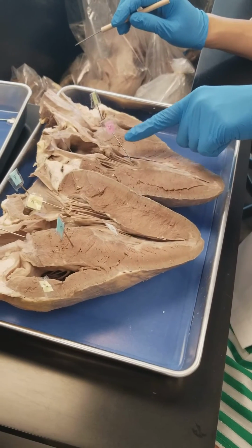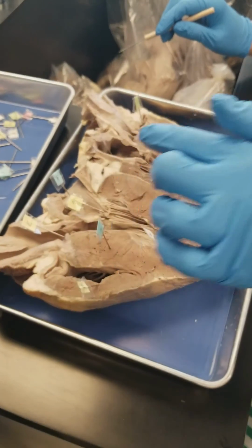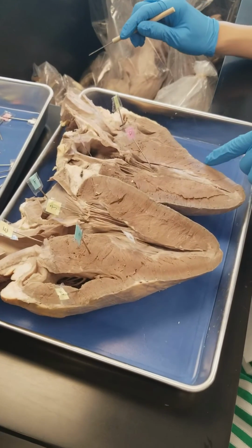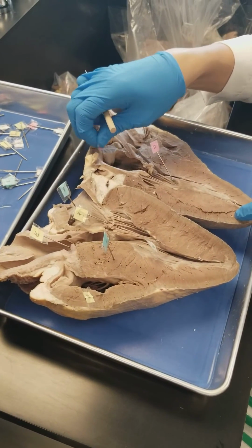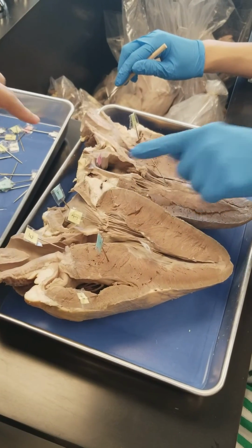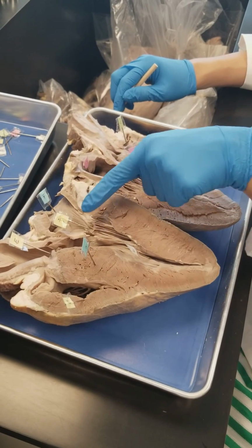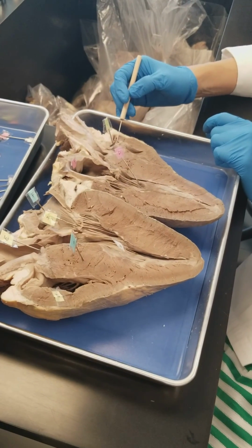E is the aortic valve. F is the left atrium. I thought you said this was that muscle. Pectinate muscle. Oh, pectinate muscle for I. So left ventricle, pectinate muscle. No, left atrium, I mean. Pectinate muscle for I. And then G is right. And then J is your mitral valve. So half of the mitral valve is here and the other half is there. What'd you say was G? Right atrium.